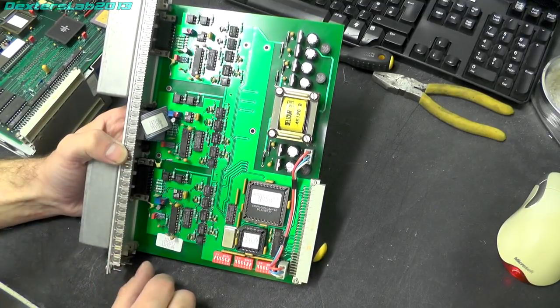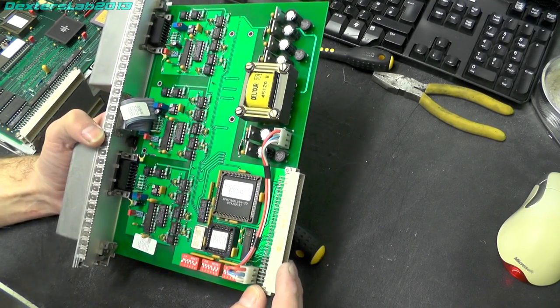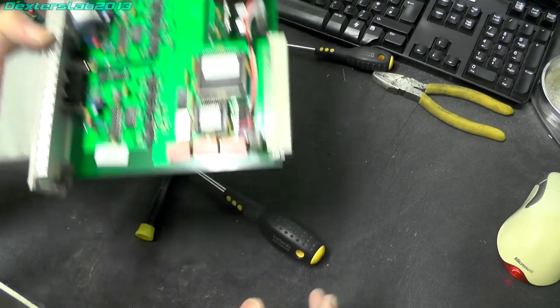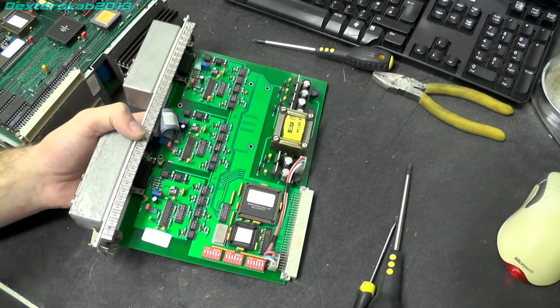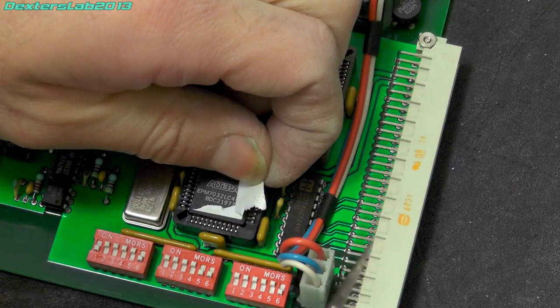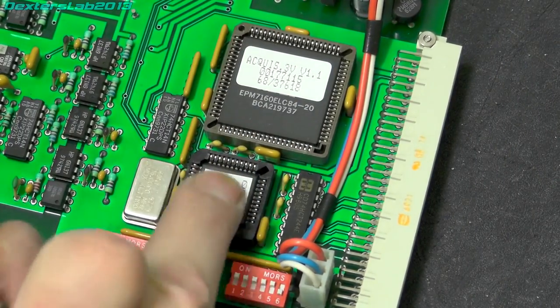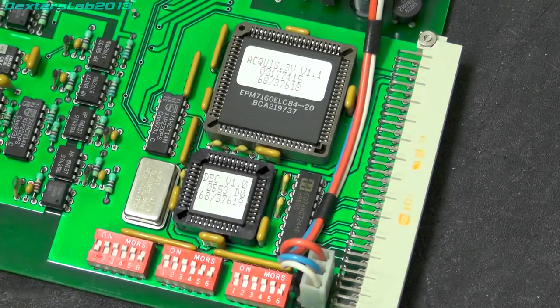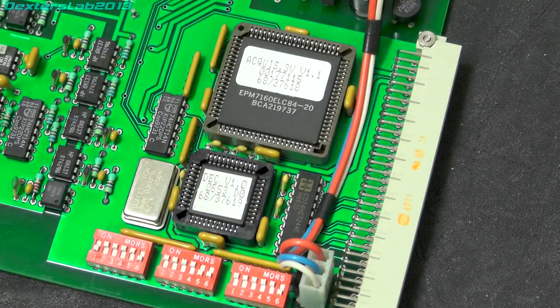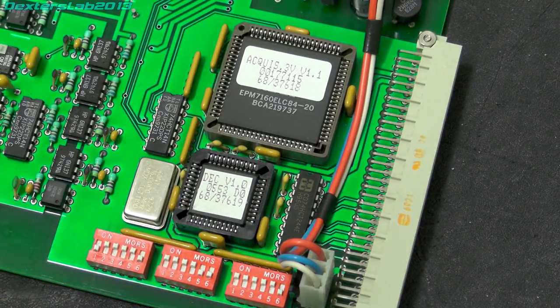EPM7160ELC84. That's just a PLD. 3200 gates. So, and then we have another, looks like a ROM or something there. Let's just peel the sticker off. And we've got another PLD, EPM7032. Which is like a smaller version of that. So yeah, not ROM. Of course, these are EEPROM based PLDs, so you don't need any external memory or anything. So yeah, obviously doing a little bit of processing to pass it through to the edge connector and then out to the processor board that we're gonna have a look at in a moment.